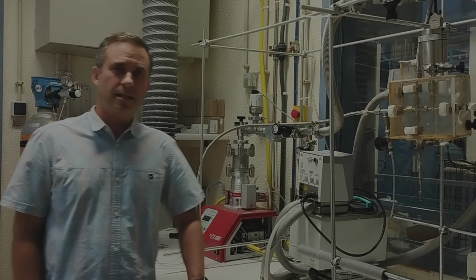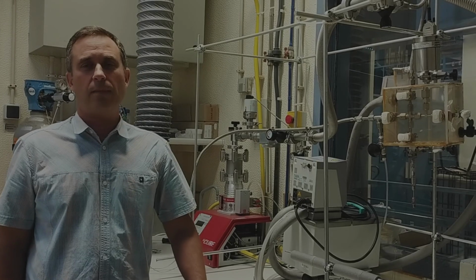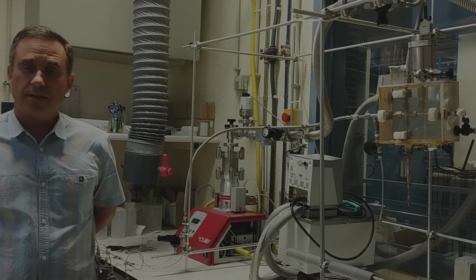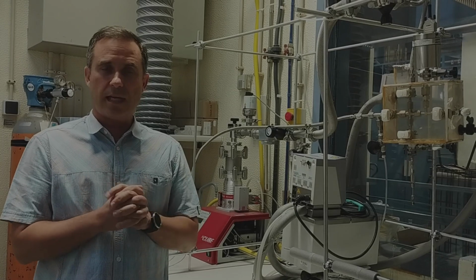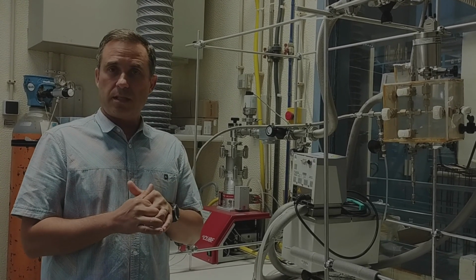Hello, this is the Adsorption Science and Technology Lab that belongs to the Chem Lab of Serena. In here we can study different types of adsorbent materials, so materials that have very small pores at the nanoscale. And in here we study the adsorption properties of these materials.